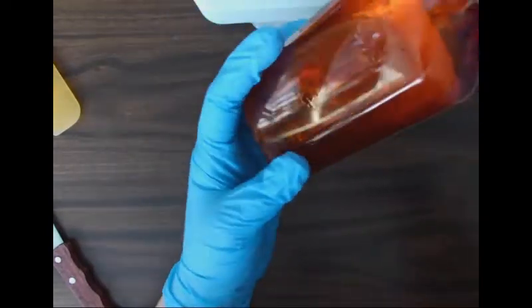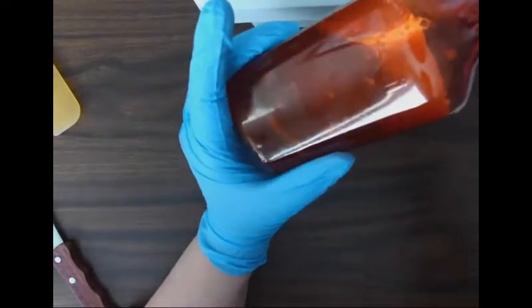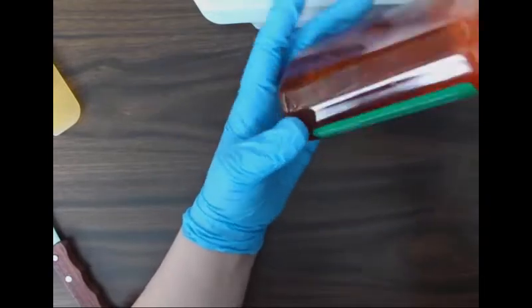Okay, so making sure to put my gloves on. Always new gloves whenever I'm starting a new compound, and switch them if they get dirty. Okay, so I'm just showing you here the PLO kits that we have. There's two parts to them. So this is part A. It's liquid when it's at room temperature. It's kind of a yellow color and consistency. I'm just trying to show you that it's liquid in that bottle there. Again, that kind of yellowy brown.